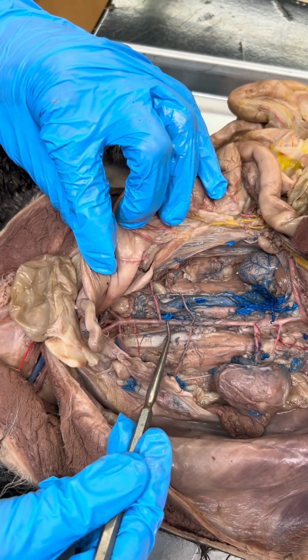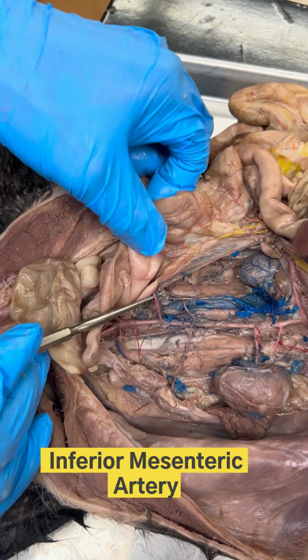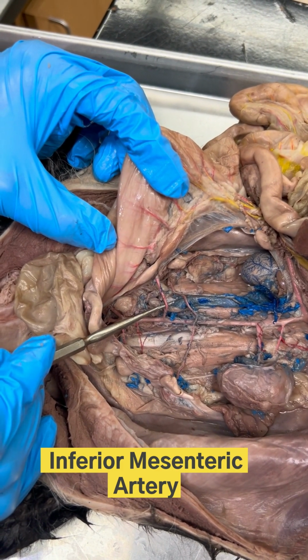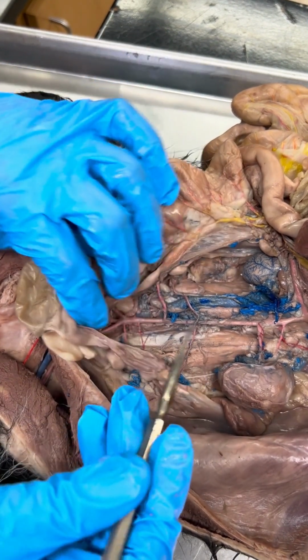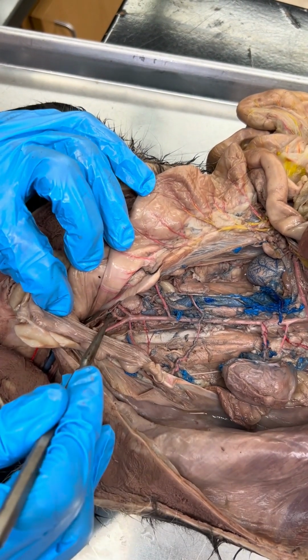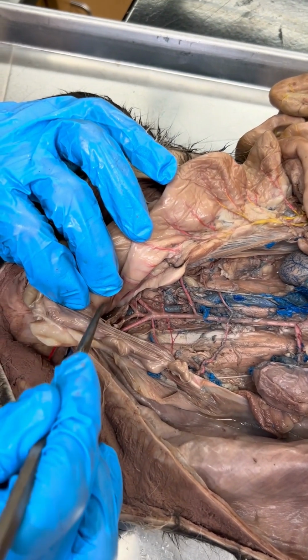As we continue down the length of the abdominal aorta, we then find a branch right here that connects to the large intestine. That makes this branch the inferior mesenteric artery. Finally, when we get down here to the distal end of the abdominal aorta, it branches at the height of the pelvis into what we call iliac arteries.